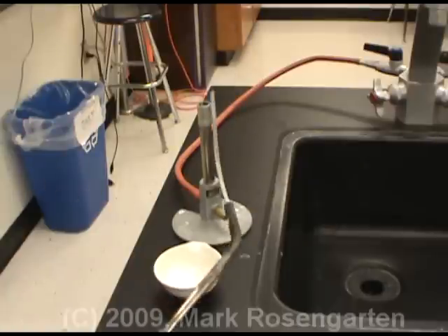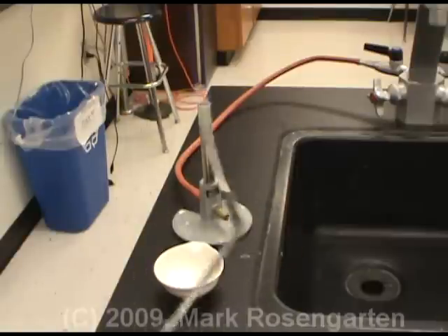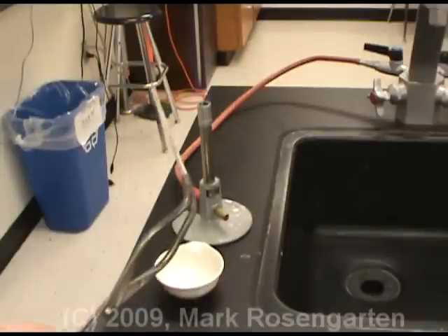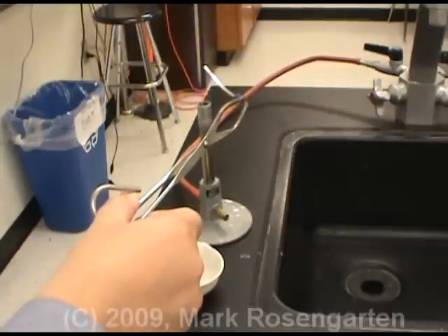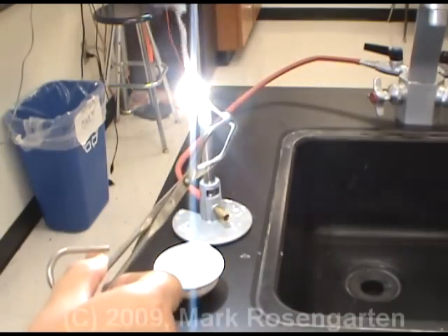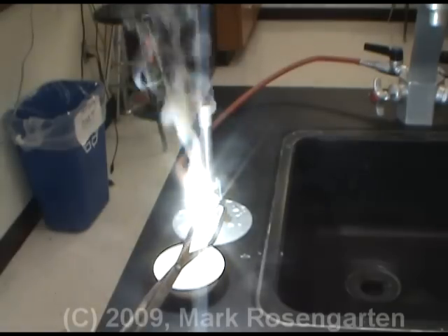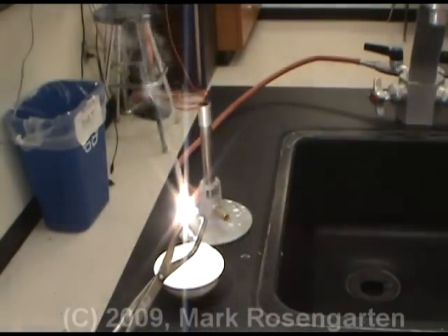For example, if I take this strip of magnesium and react it with the oxygen in the air, it's slowly going to oxidize to form magnesium oxide — a synthesis reaction. But this takes place very slowly unless I add what's called activation energy by placing the magnesium strip into a heat source like a Bunsen burner. This is a highly exothermic reaction and the smoke you see is actually particles of solid magnesium oxide.